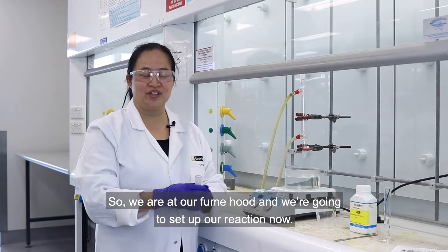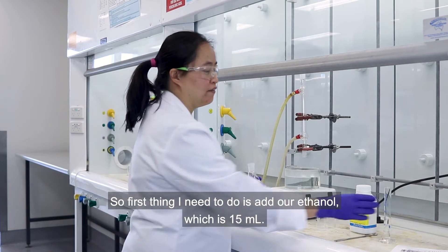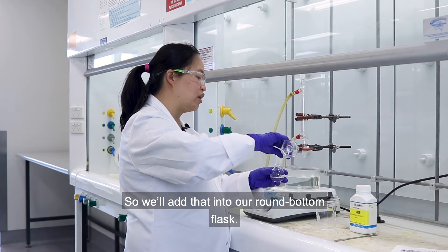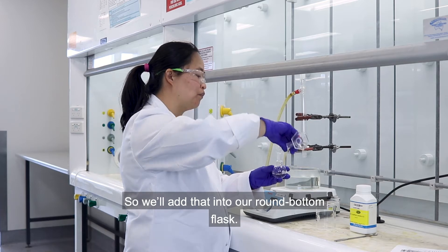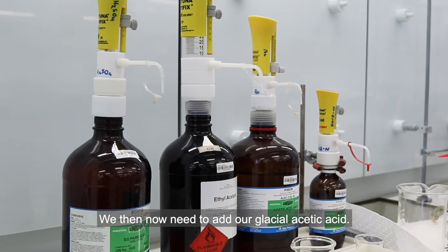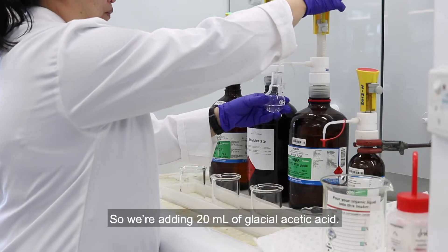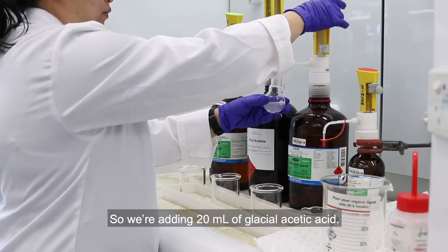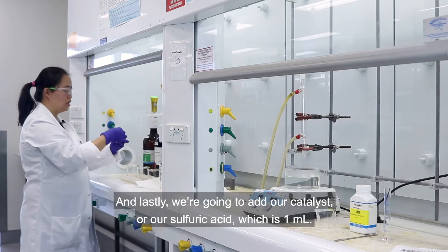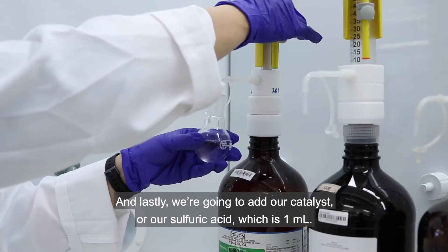So we are at our fume hood and we're going to set up our reaction now. First I need to add our ethanol, which is 15 ml, into our round bottom flask. We then need to add our glacial acetic acid — 20 ml of glacial acetic acid. And lastly we're going to add our catalyst, sulfuric acid, which is 1 ml.